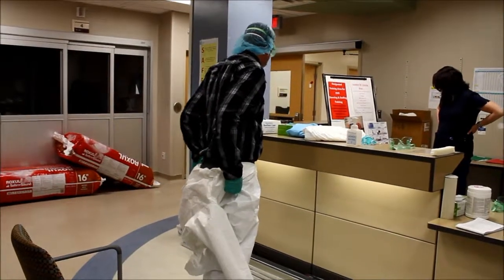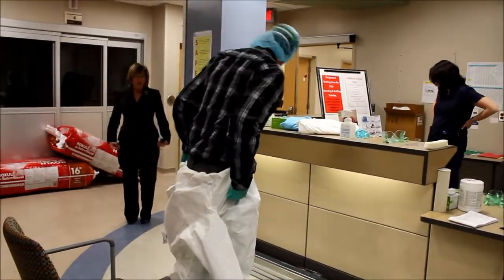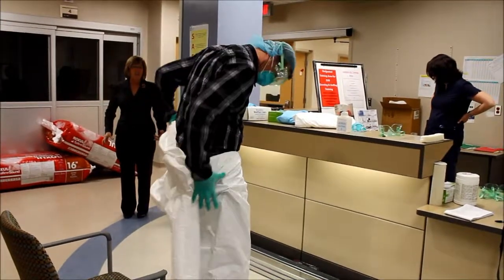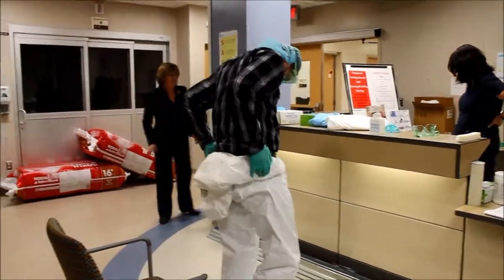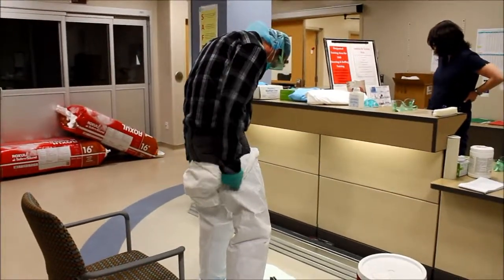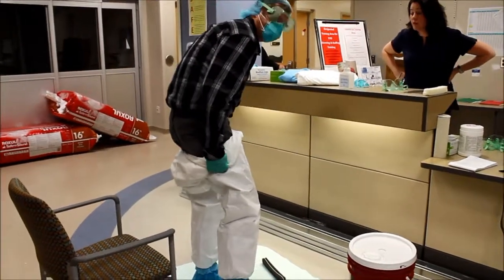Then you're going to try to contain it — roll it so that it's all going under. Try to wrap it together and roll it down so it's in as close a bunch as you can. It makes it tough not to touch your body. Yeah, it's really tricky.